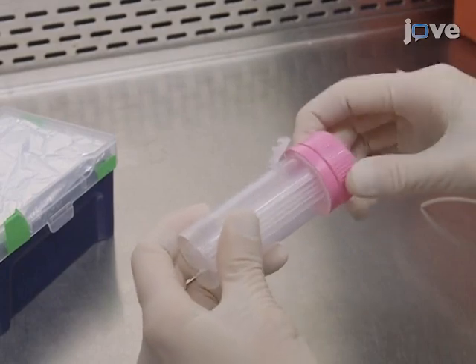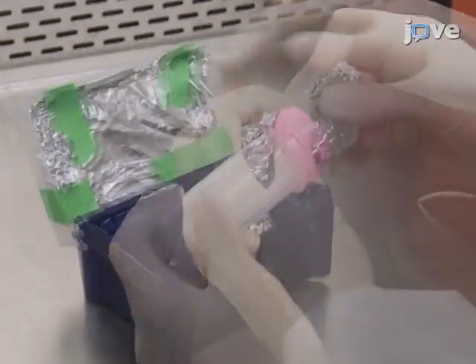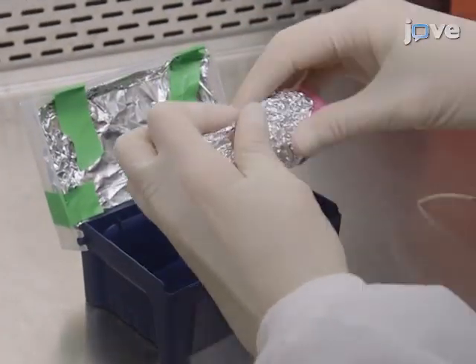Finally, store the microarray sealed in the dark at 4 degrees Celsius under oxygen-free nitrogen or argon gas.